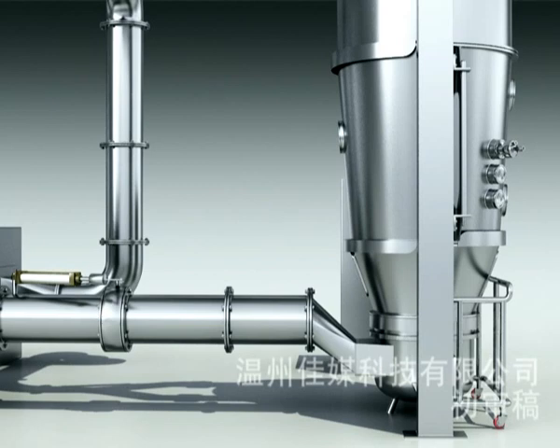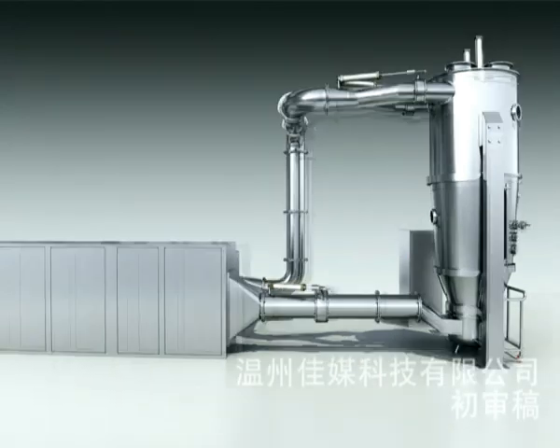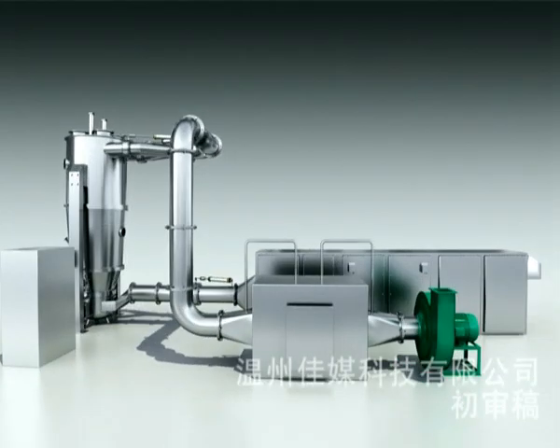4. Pressure differential transmitters or gauges are normally supplied with the air inlet and exhaust filter, fluid bed, and powder collecting chamber, so as to check if there is any blockage or leakage in each section. The ones with the powder collecting chamber and the first air exhaust filter, if any, are normally transmitters. They should stop the system when any measured pressure difference is out of the set range, so as to avoid leakage of material products and pollution of the environment.